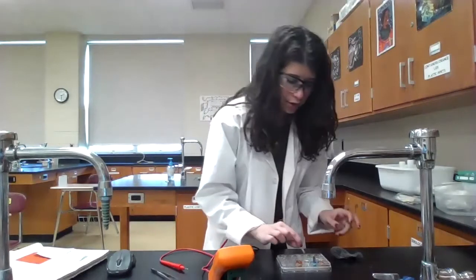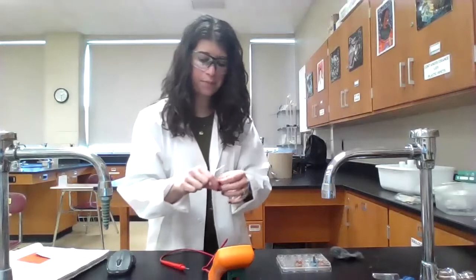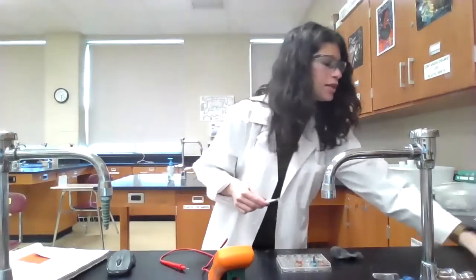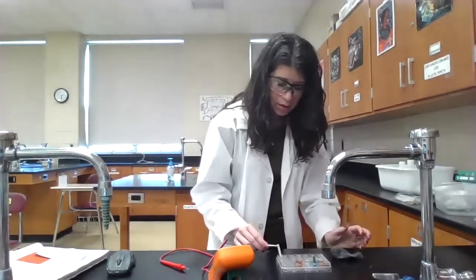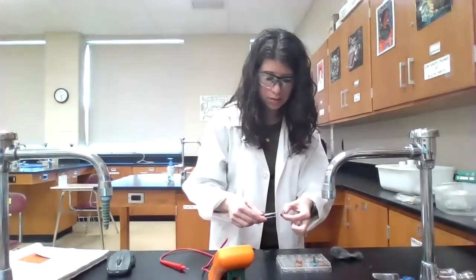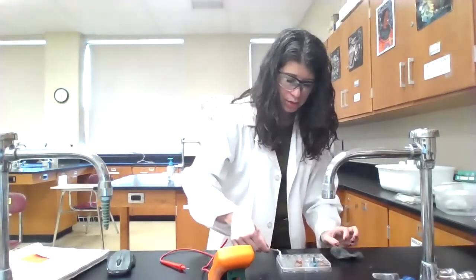And we have our diagram there. Get another piece of filter paper. And this is just regular filter paper that I've just simply cut into strips. Soaked there.